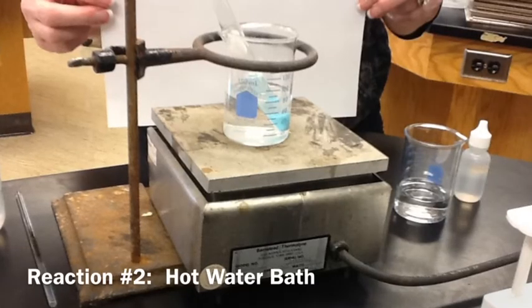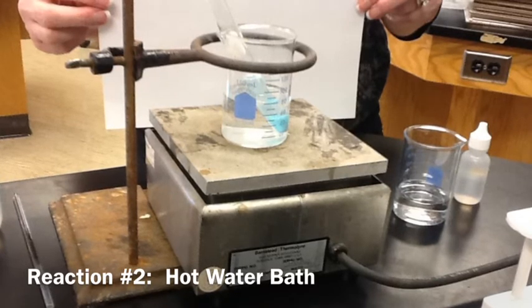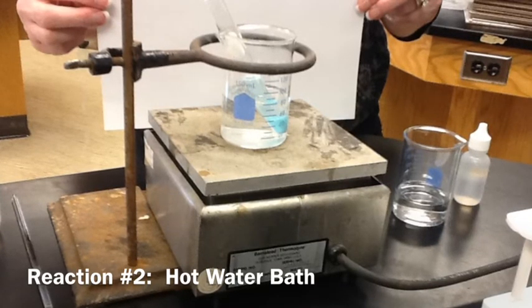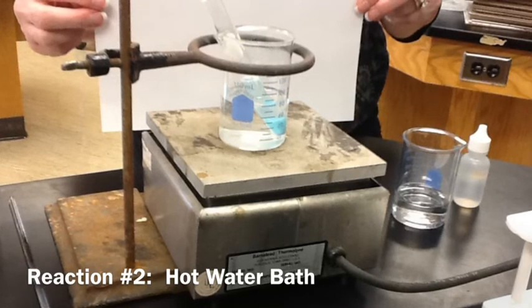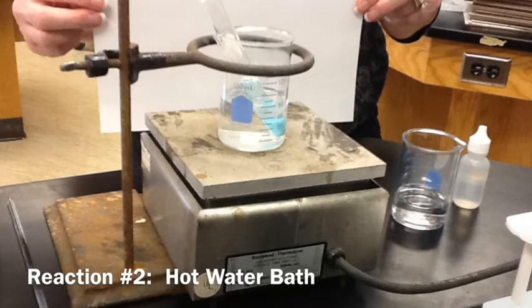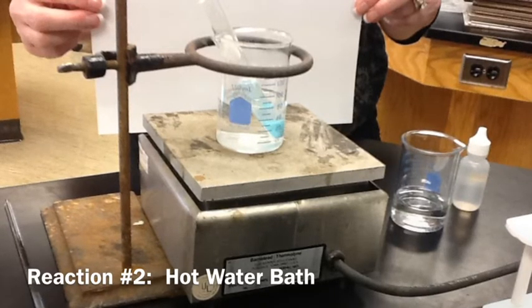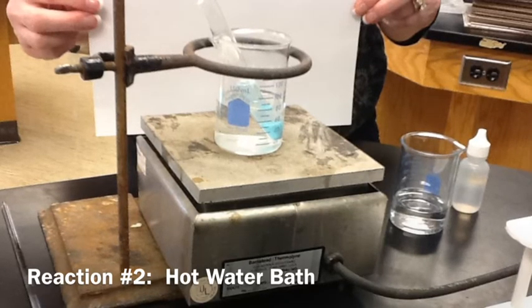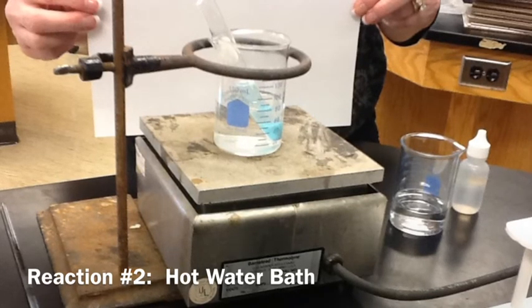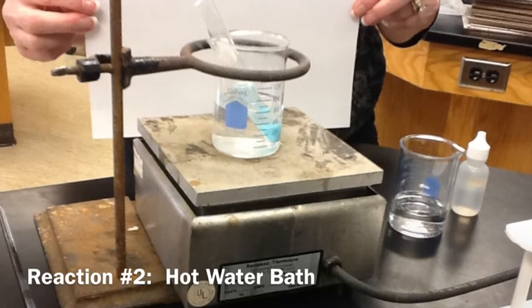This shows the copper 2 hydroxide in the hot water bath. At this point, the water should be hot, possibly starting to boil. If the water level gets low, please let me know and I will refill it with distilled water. If we use tap water in the hot water bath, it leaves a film of minerals that's hard to get out, so I prefer to use distilled water.